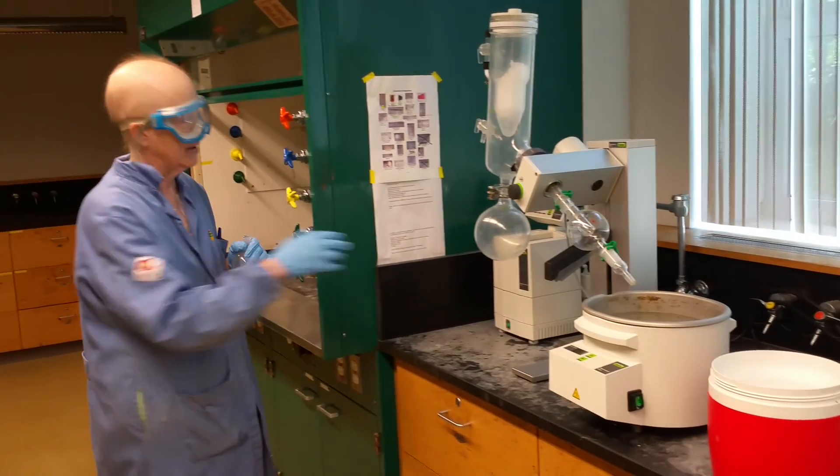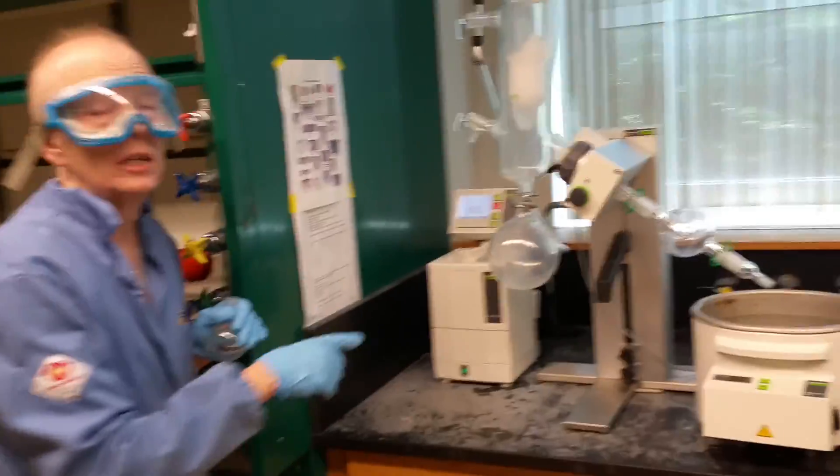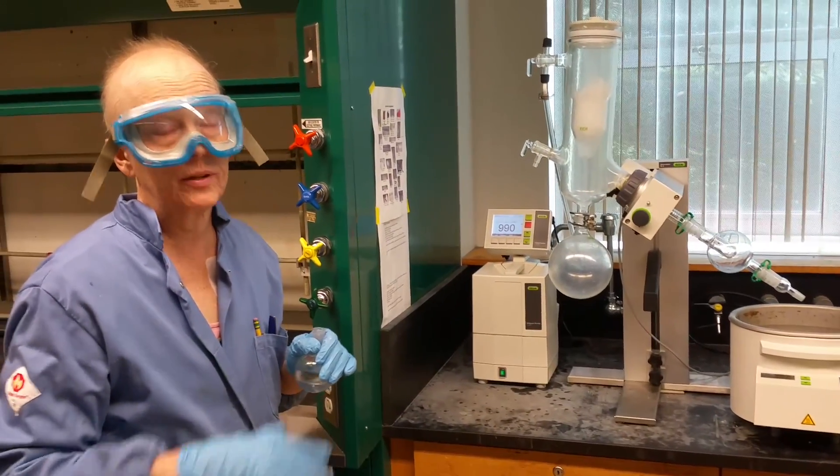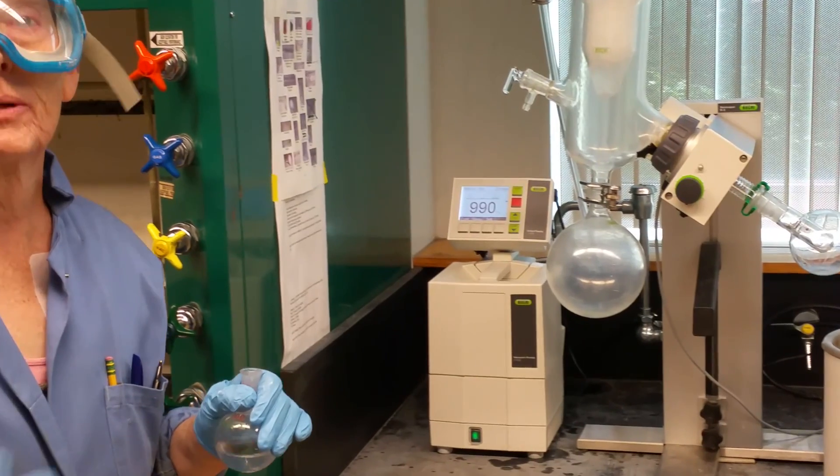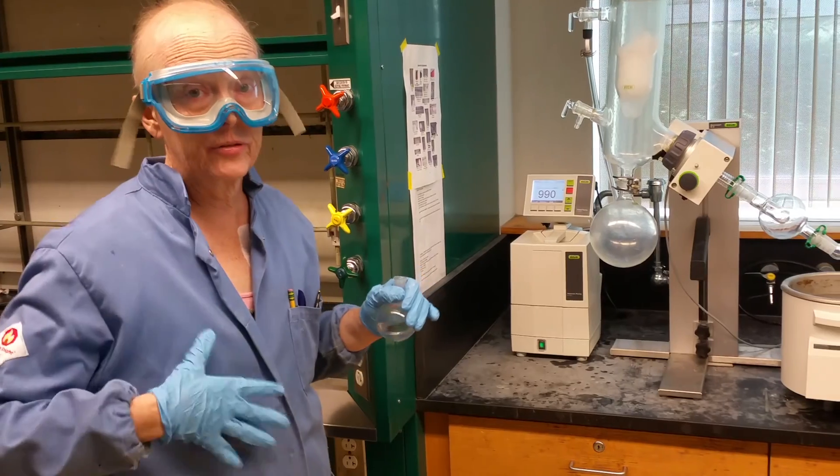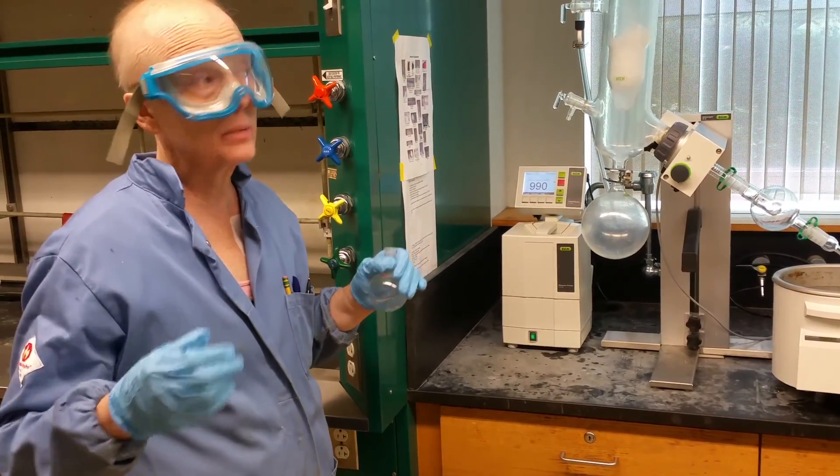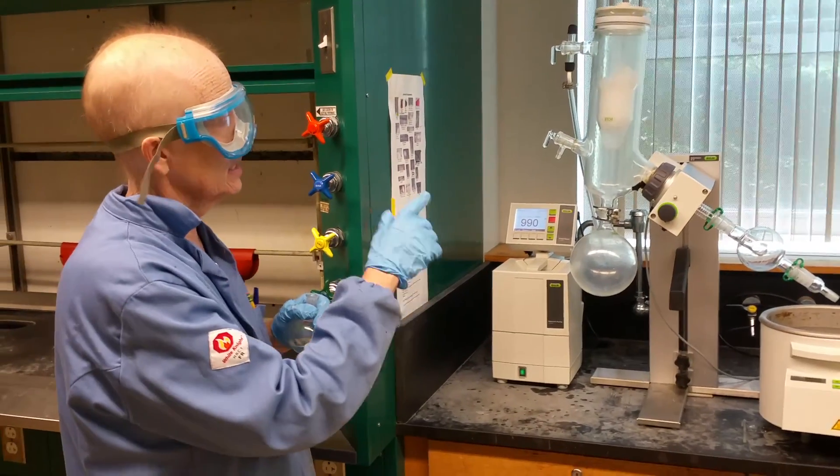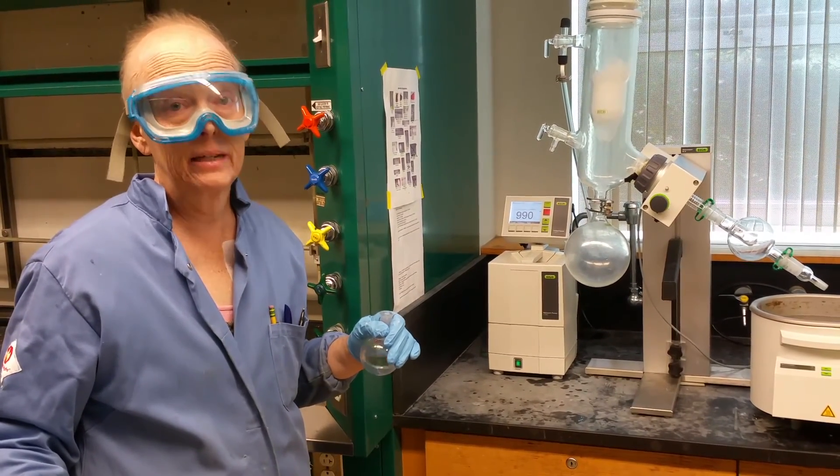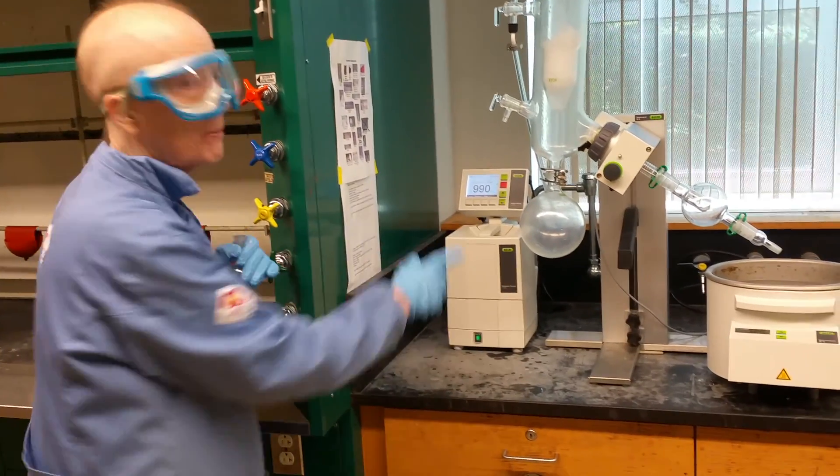Now I'm going to go to how you do it, and then I'm going to explain how it works. These work with a pump, and when you come into the lab, the pump will be on. Do not start operating these without discussing it with your instructor or TA. If it appears to be off, get someone to help you. Notice I am fully geared up: goggles, gloves, lab coat. You guys will wear an apron.